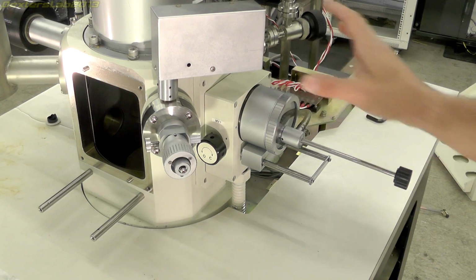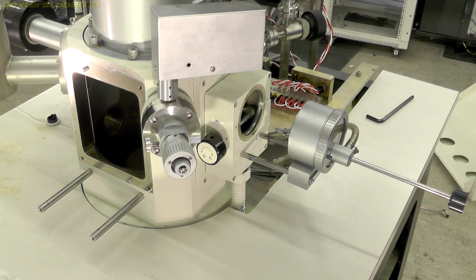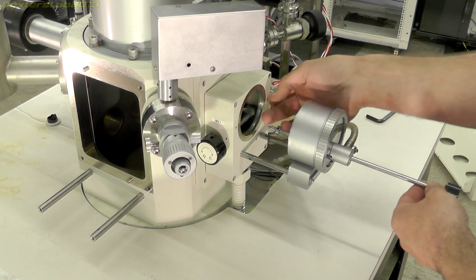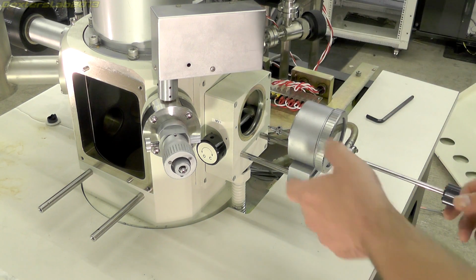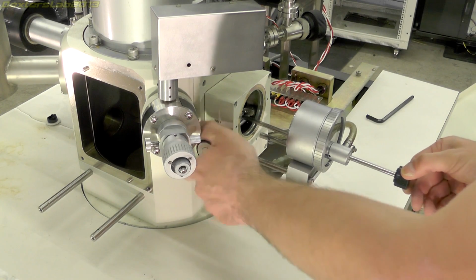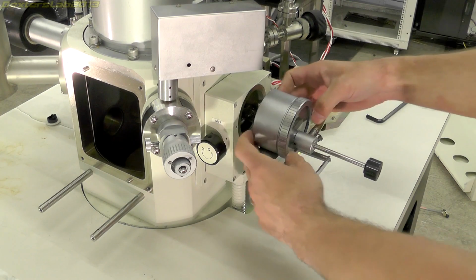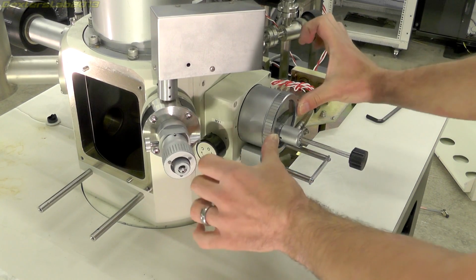And on the other side, we have that sample exchange chamber. So this is a separate chamber which has a partial vacuum on it. This has a little window in and this control knob. So presumably you can attach a sample onto the end here. It would probably be mounted on some kind of little table or something that can be inserted into and then attached to the actual sample chamber on the inside once you've opened the little airlock. This doesn't have any bolts or anything to secure it into place. There's just a gasket round. I suspect it's just pushed up and then the vacuum system itself pulls it tight and makes the seal.